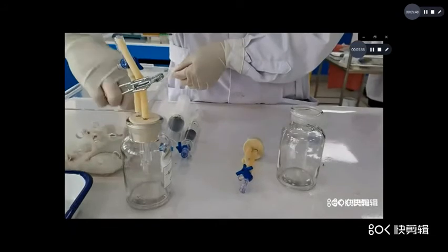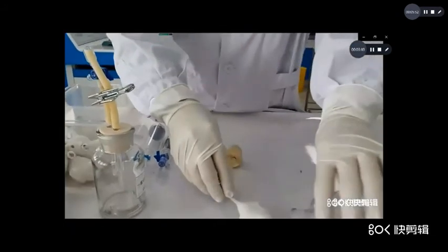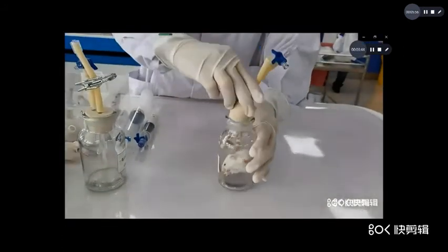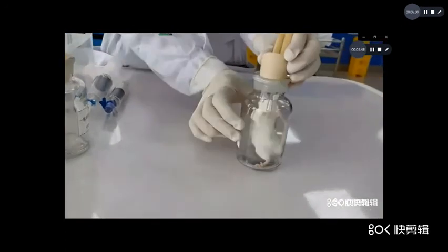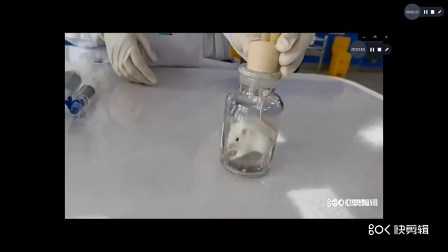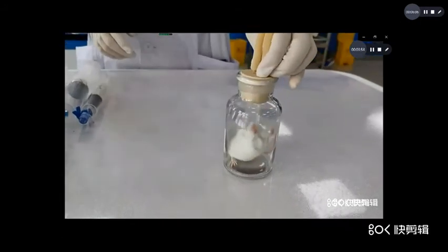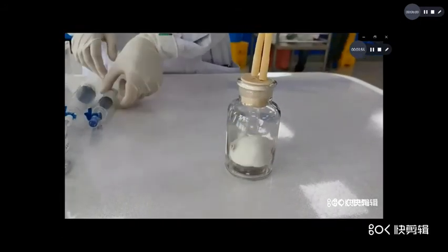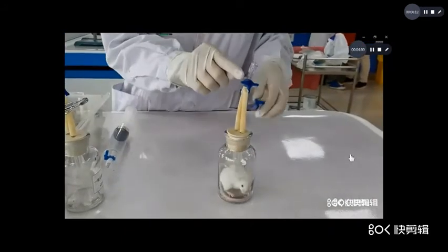Now first, take a mouse into the jar. Now you observe the respiration and the color of skin and lip. Now it is normal. Now close the jar.